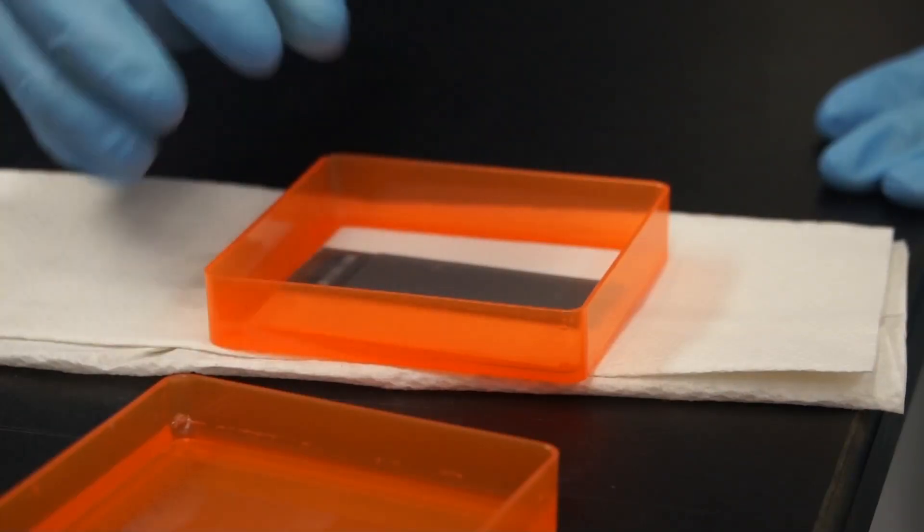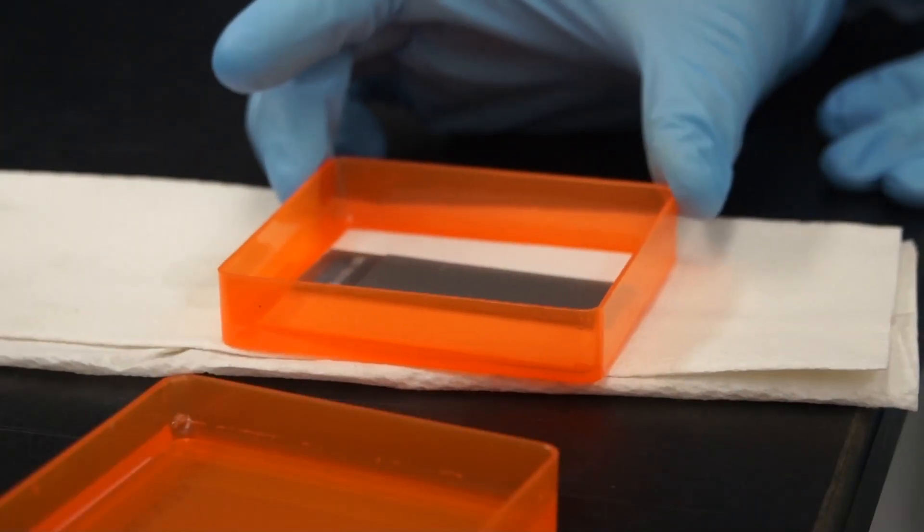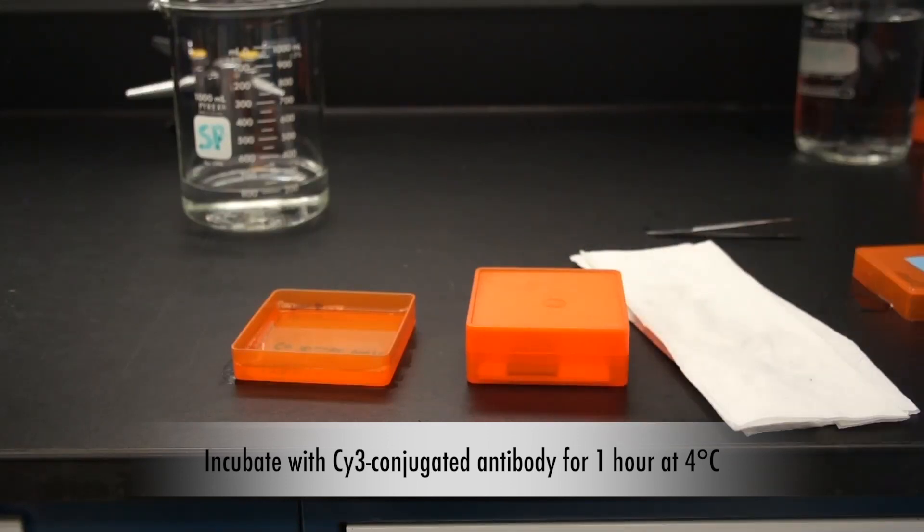Gently apply the coverslip and incubate in an incubation chamber at 4 degrees Celsius for 1 hour without shaking.